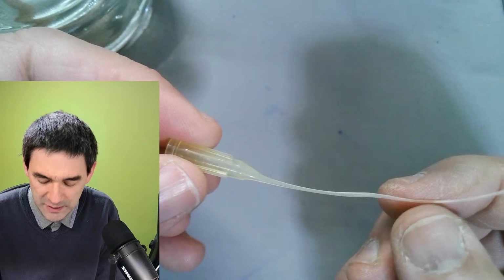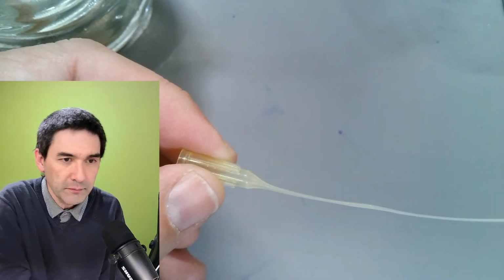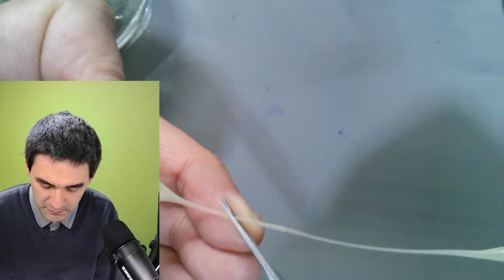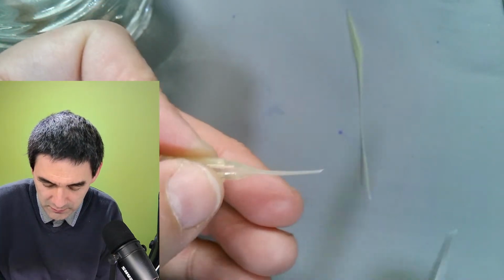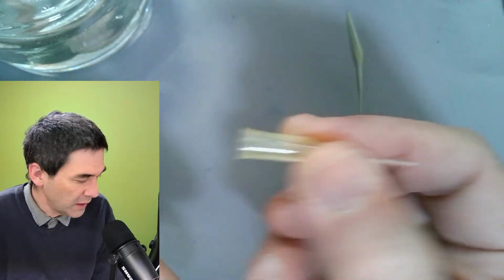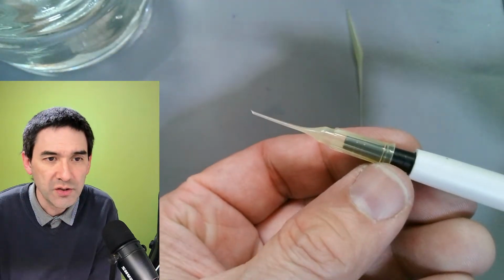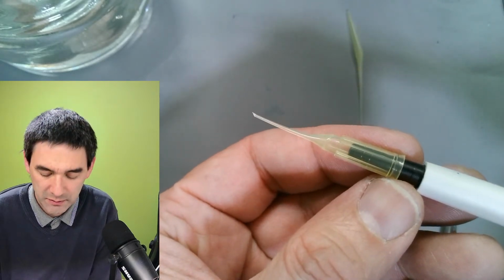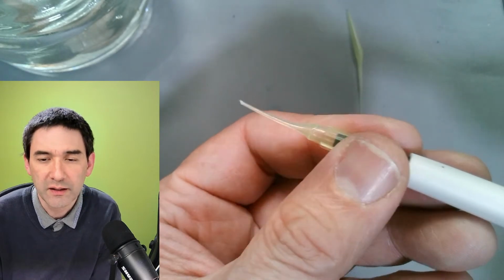Yeah, so this is actually much thinner, and then I cut it. Okay, something like, yeah, usually maybe diagonally, right? And this is significantly thinner, of course. The question is now, how can I put it on another one? Well, of course, I could directly put it on here. That's of course the easiest way. Yeah, so that's possible. And you could actually directly pick up objects like this, yeah.